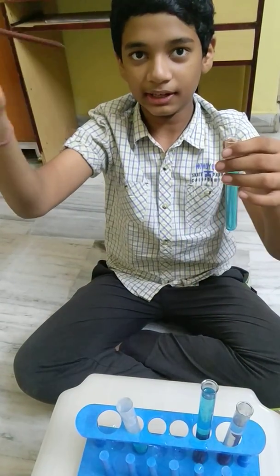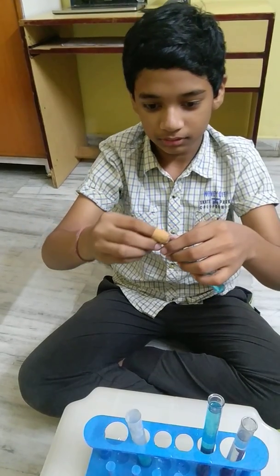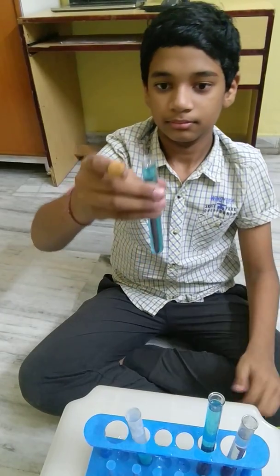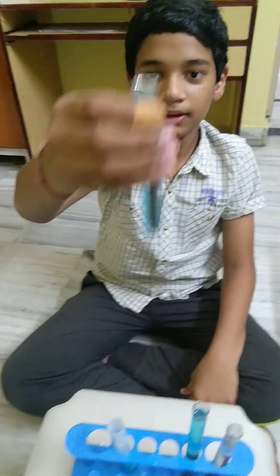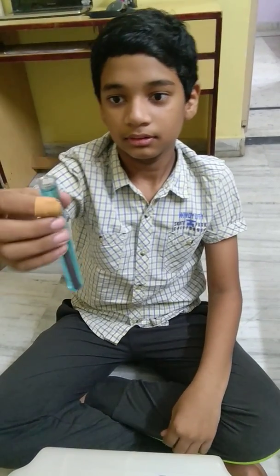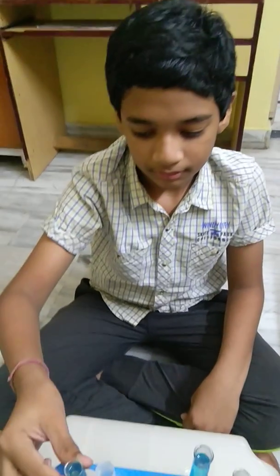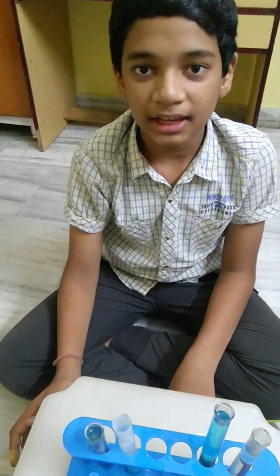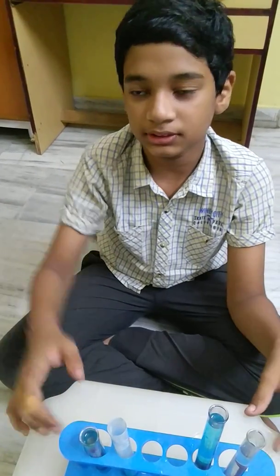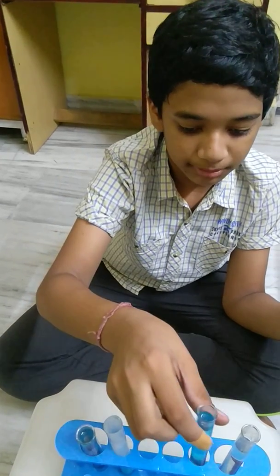Now, let's do something crazy and dip the entire nail into the copper sulphate solution. When I leave it there for around 2–5 hours, iron — being a more reactive metal than copper — displaces copper and forms iron sulphate. I have prepared another sample.